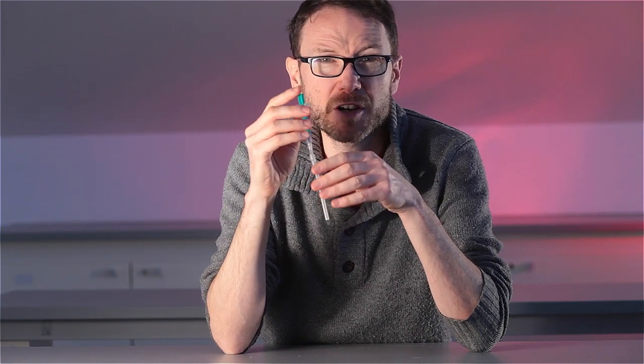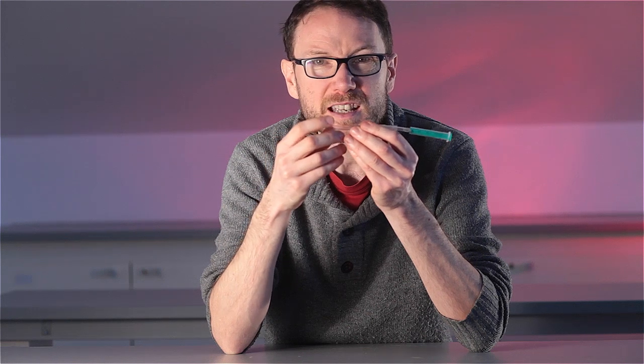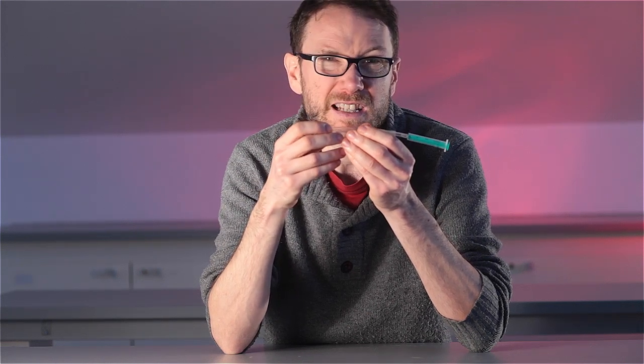The syringe holds the liquid in place so that I don't have to maintain pressure on a pipette teat, and that tiny little bit of air means that I can get all the liquid out and I don't have to end up forming a precipitate inside my pipette, which can be tricky to clean.